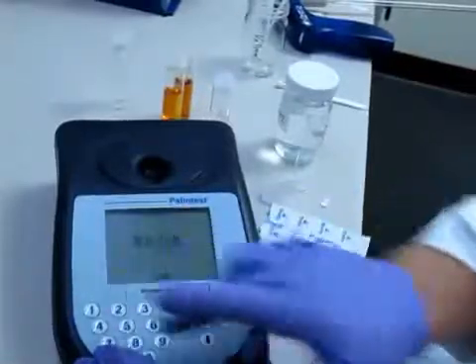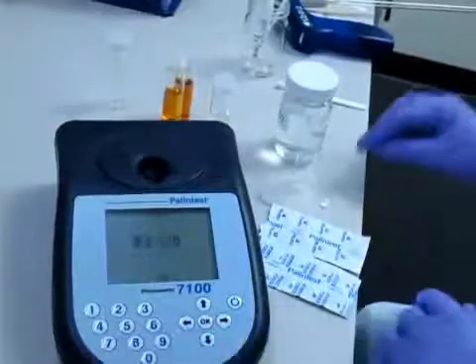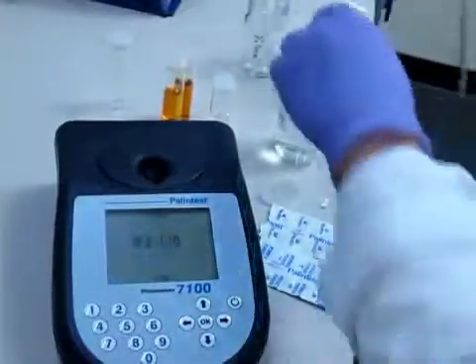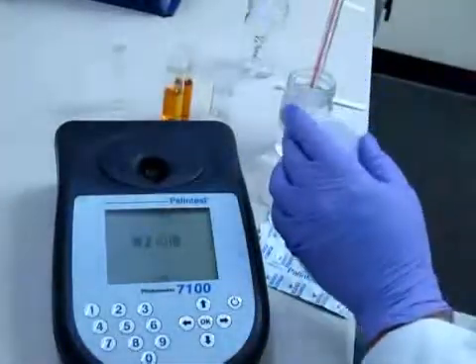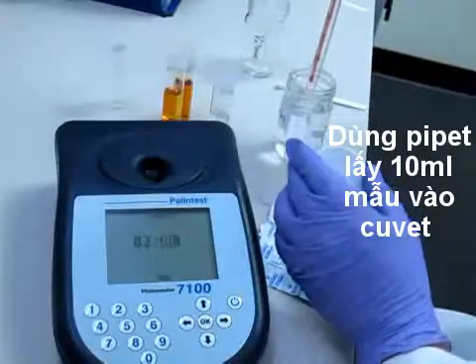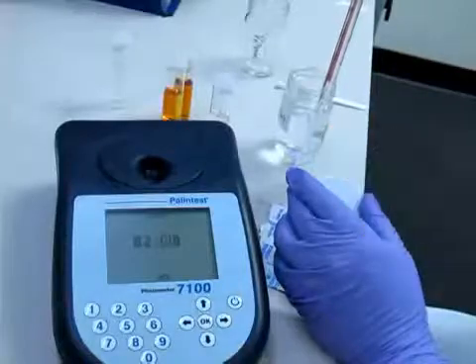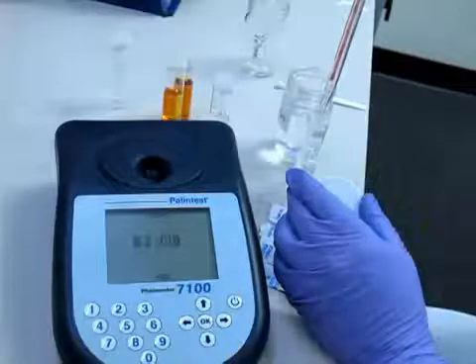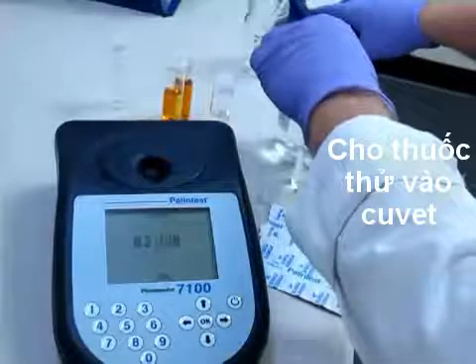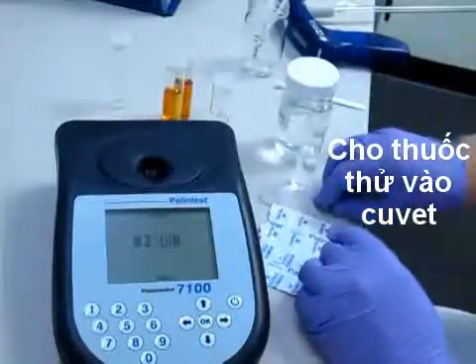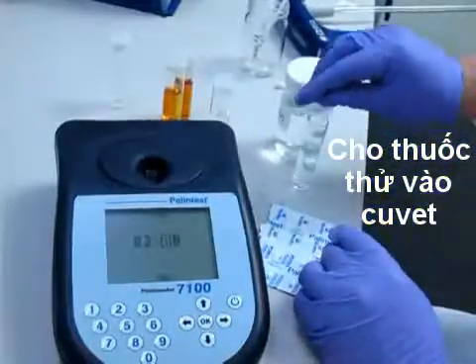Then I'm going to take my sample, 10 mils. If you don't have a pipette, you can fill to the line on the vial. Drop the two tablets in and start the timer.